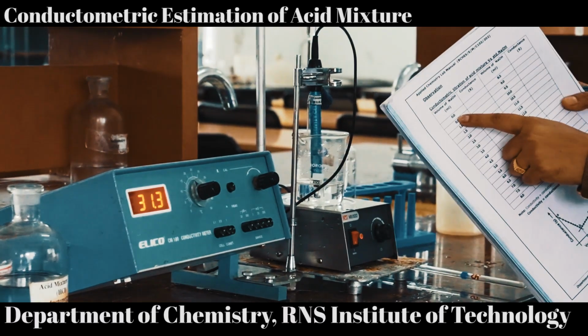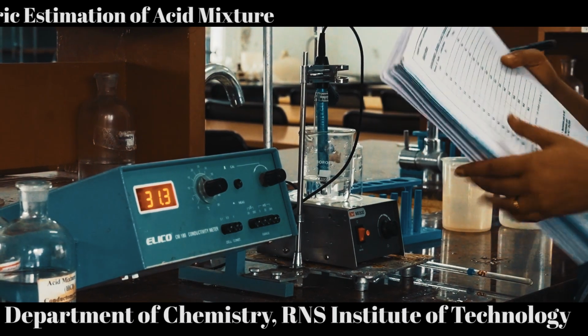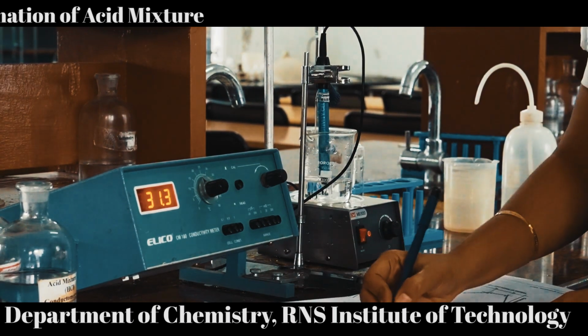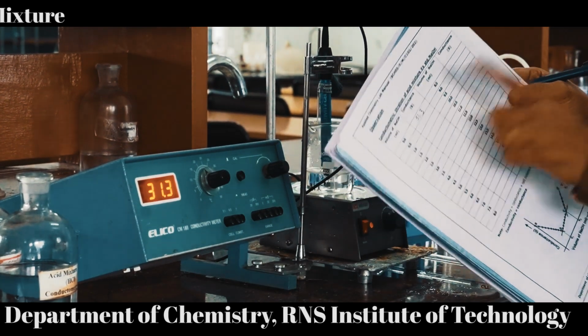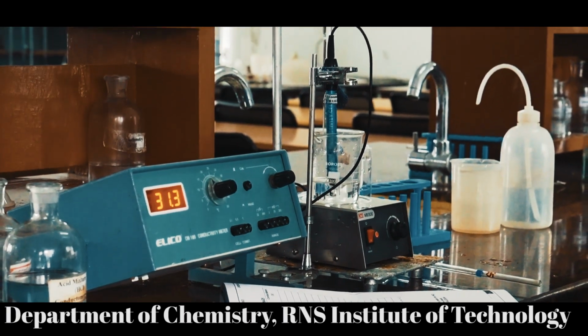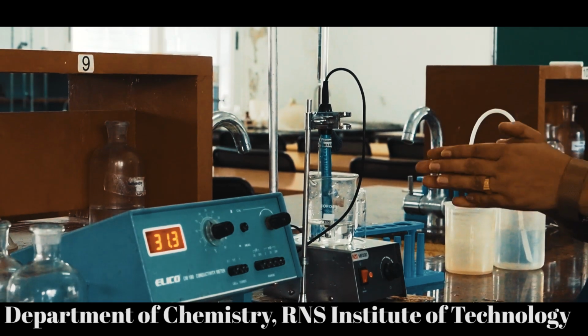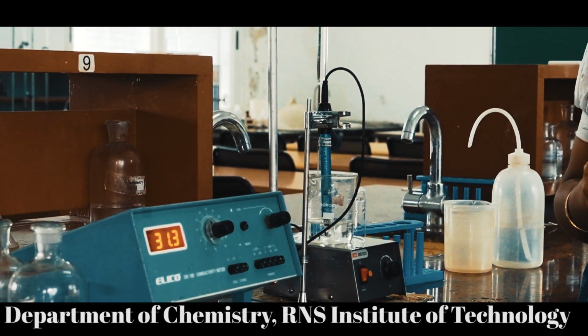We have not added any titrant, which means we have not started any reaction. So first the initial reading we should note down. The initial reading is 31.3. Note that down in the given manual. Then we are going to start the titration. As I have already told you, since it contains both strong acid as well as weak acid, first the strong acid will be neutralized.